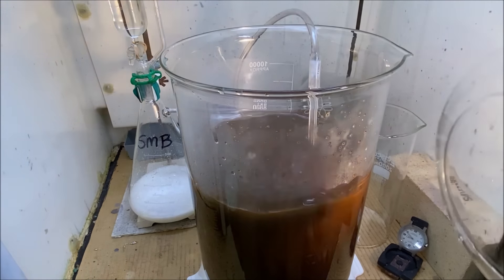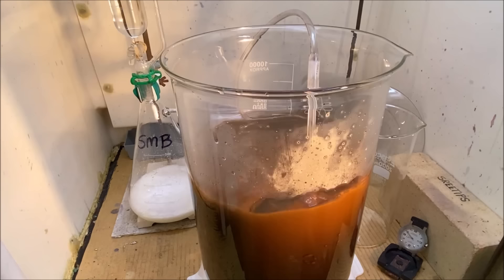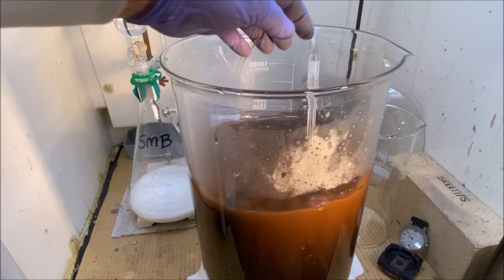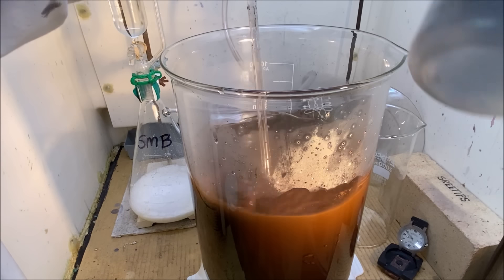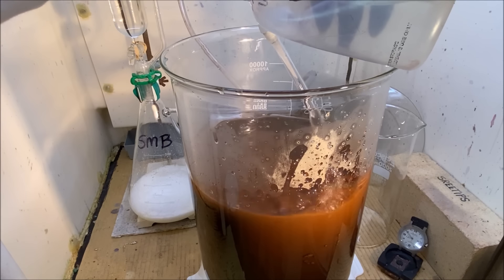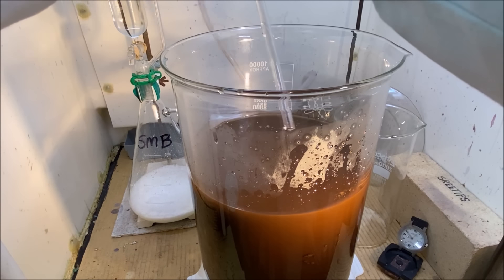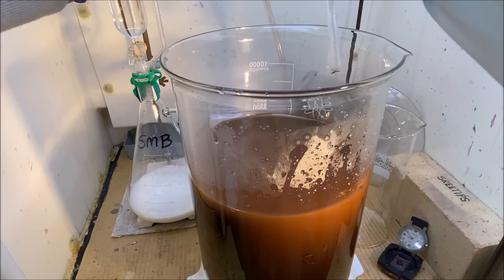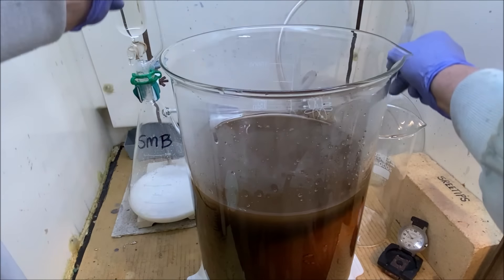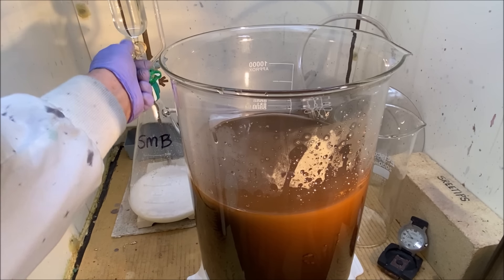Let's get in here and what I want to do is rinse any gold off of this delivery tube that may be in here. Just a little bit down on the end, not much at all. And now, what we'll do is kill the acid flow into the gas generator.